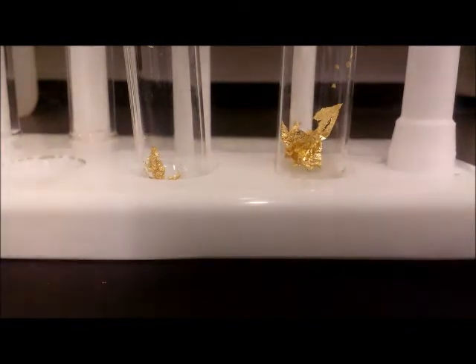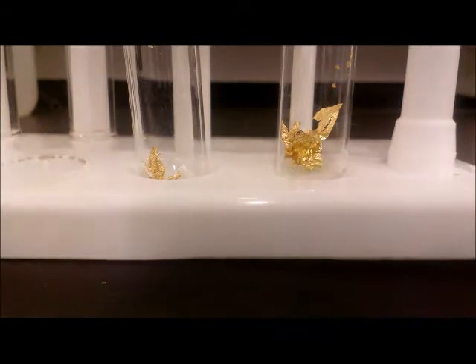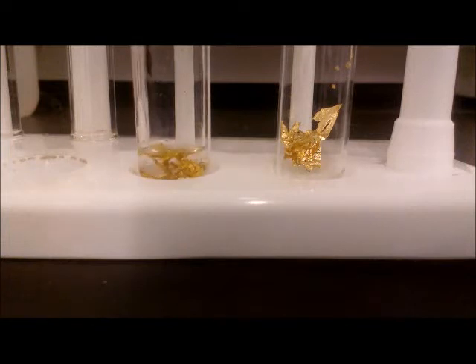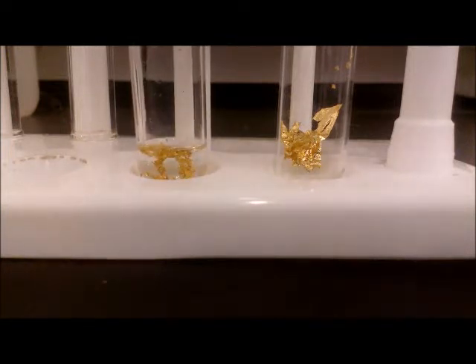Gold has been famous for thousands of years for its corrosion resistance. To demonstrate how resistant, observe the test tube on the left as I add concentrated nitric acid. You can see that there is no reaction.